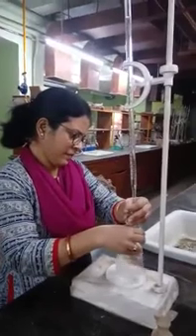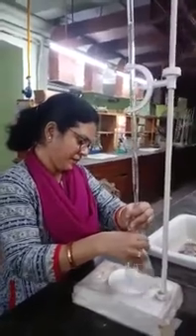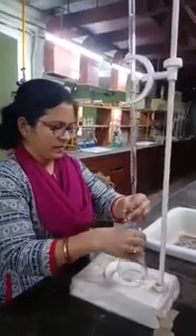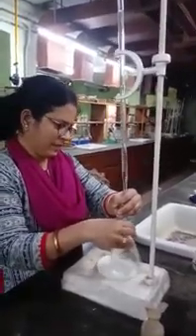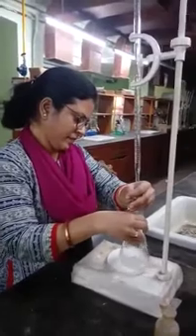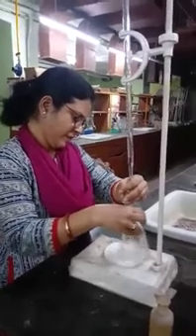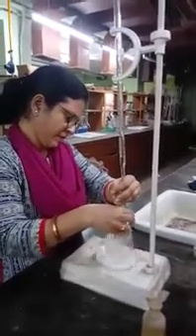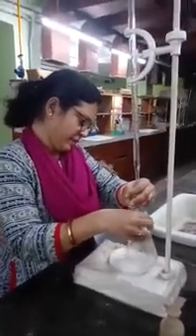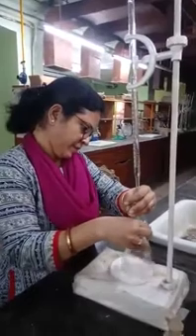In the burette, you take the sodium hydroxide solution. In this case it is reverse. Normally we take acid in the burette, but over here the sodium hydroxide is taken in the burette, and 25 ml of oxalic acid has been pipetted out in the conical flask. To it 2 drops of indicator phenolphthalein has been added, and it is now being titrated against sodium hydroxide. You will repeat this titration at least 2 times, and the burette readings should not differ by more than 0.2 units.